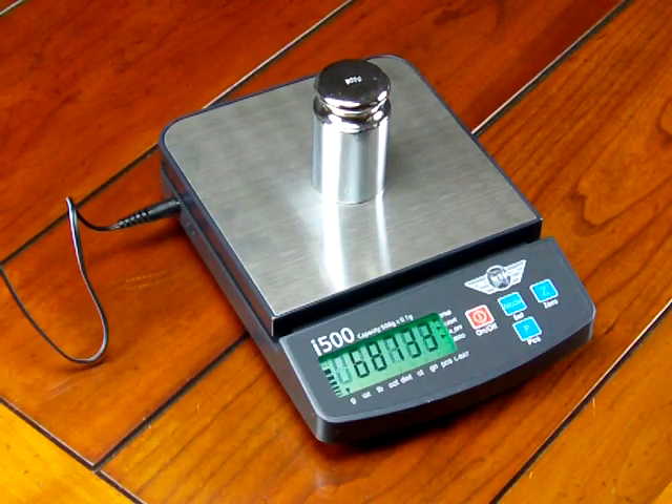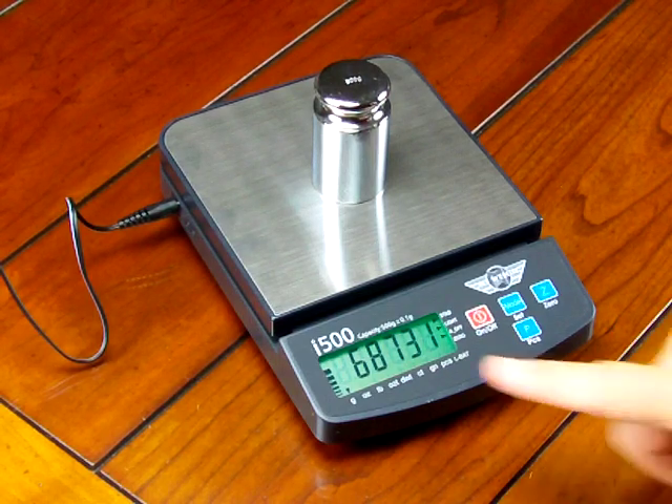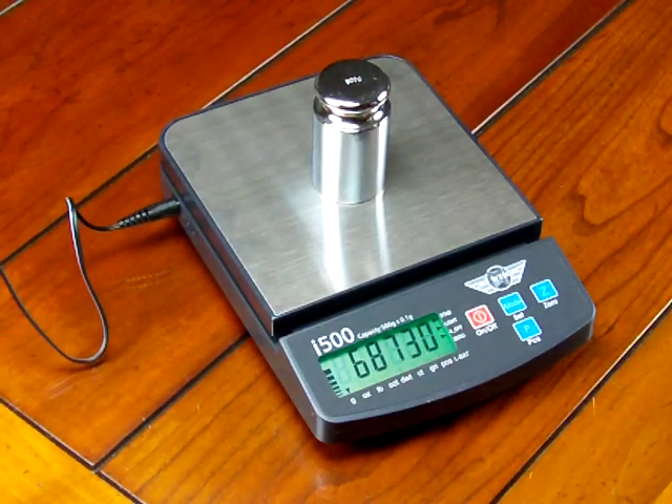We're going to see a random number from the A to D converter. You saw zero save, meaning it stored the value at full scale. And then this is the number coming off the A to D converter — it means nothing. It's just a random number; to you it means nothing at all.